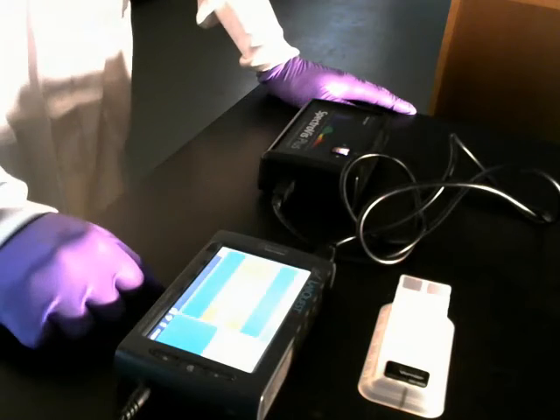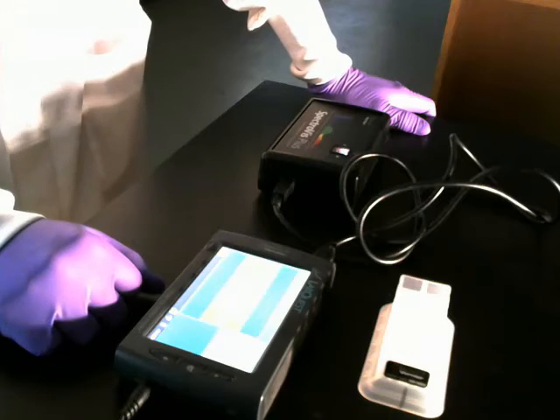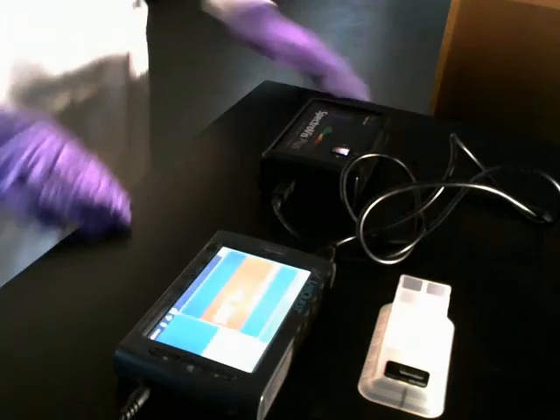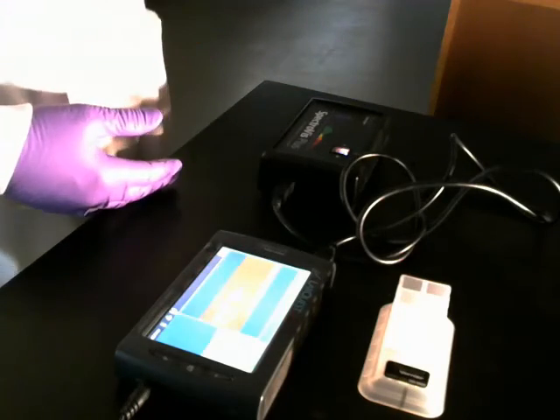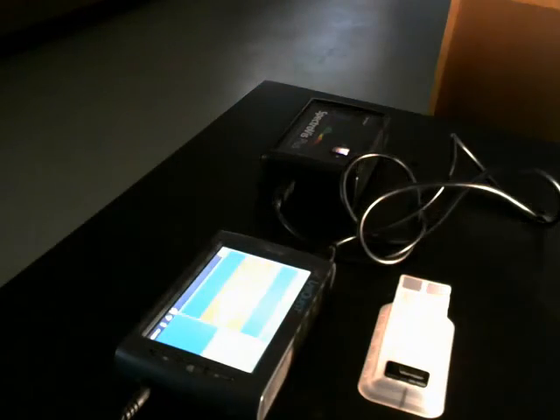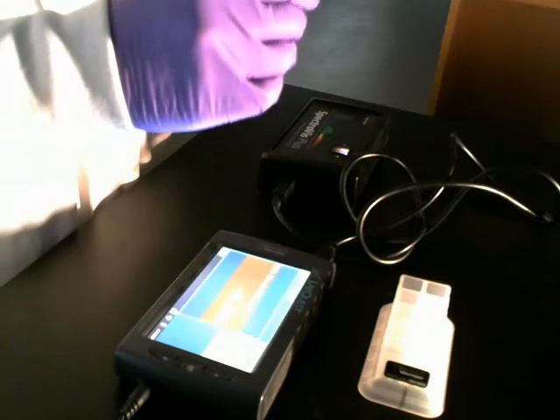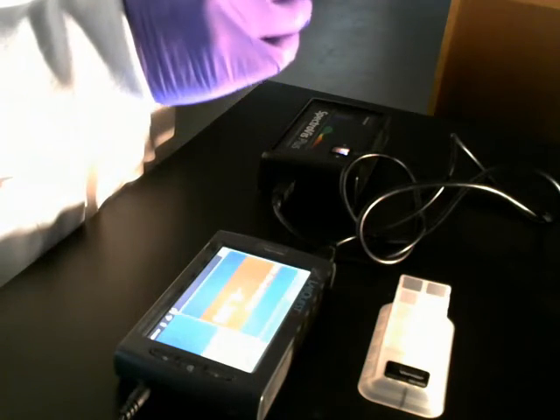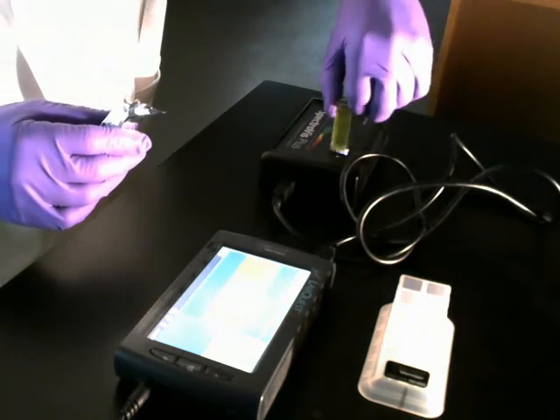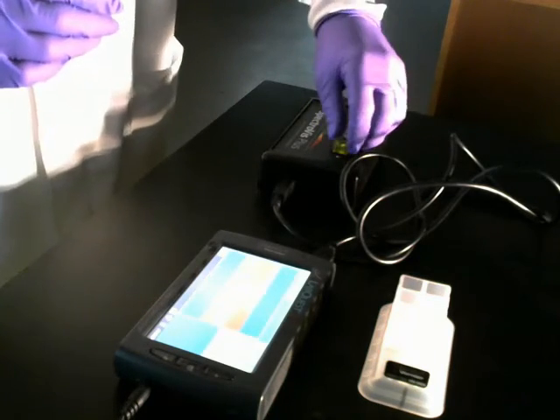So I'm doing light intensity. You all could have done something like testing the effect of different colors on the cuvettes. The procedure would be exactly the same. In other words, you would put the same things in each of your cuvettes. You'd even use the same controls. The difference would be, instead of setting them at different distances, you would simply wrap each cuvette in a different color cellophane, plastic.